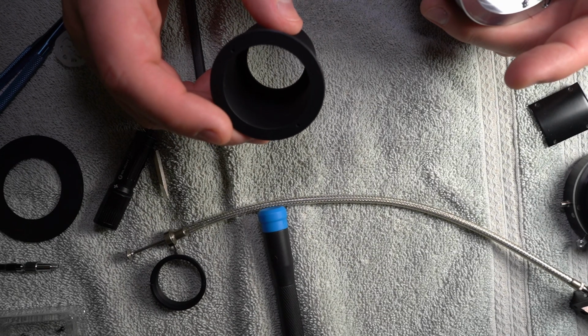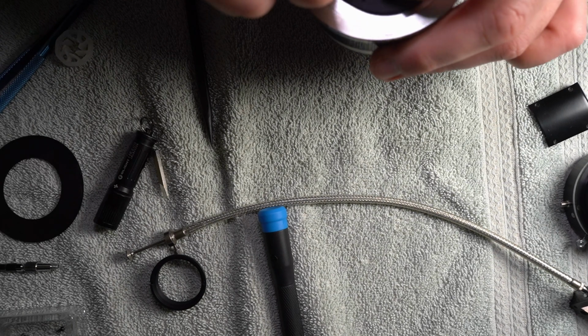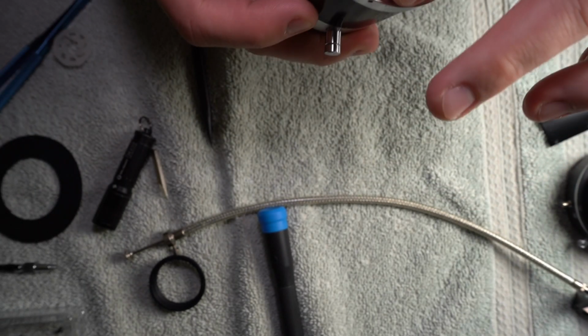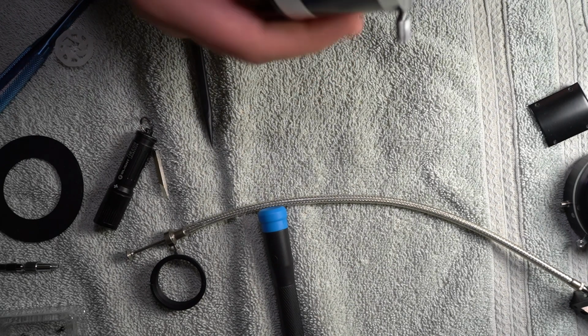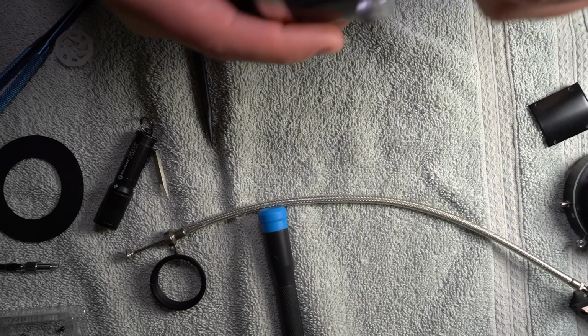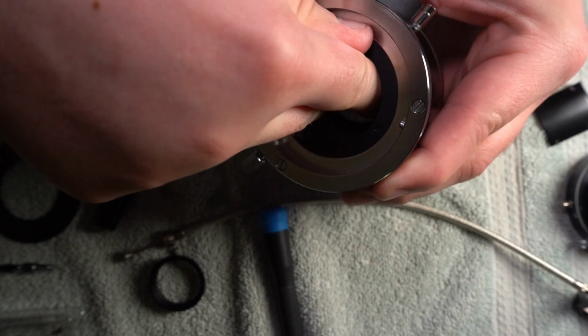It's kind of redundant because, like in England, they call wrenches spanners. So it's like wrench basically, but it literally spans a divide there. But anyway, man, that's going to be difficult to get it in there. Maybe. Oh. Should have said that sooner, because now it works. And it doesn't sound very good, but I don't know what to do about that, so I'm not going to bother with it. So I'm literally just putting my fingers in here and spreading them out and getting enough torque to do this.